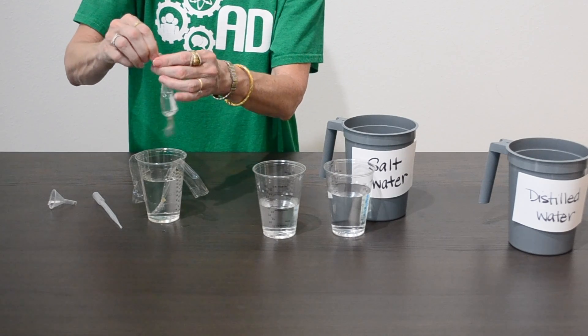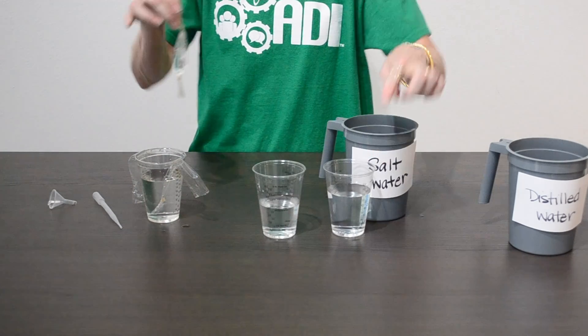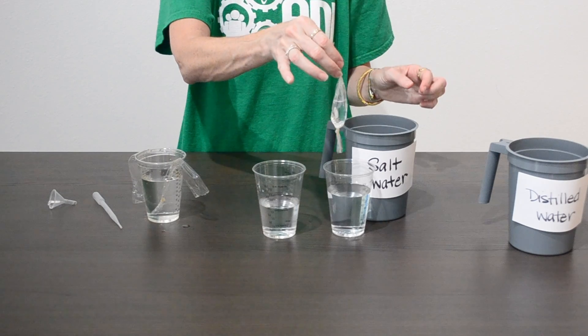Once you get that second knot in there, pull it tight. Eventually, once your students move forward through the investigation, they're going to immerse the cell in the salt water.